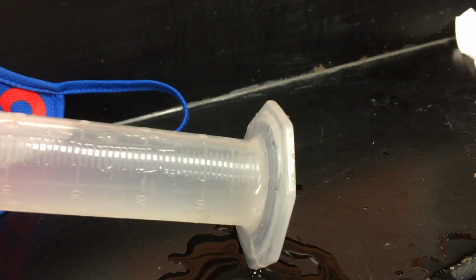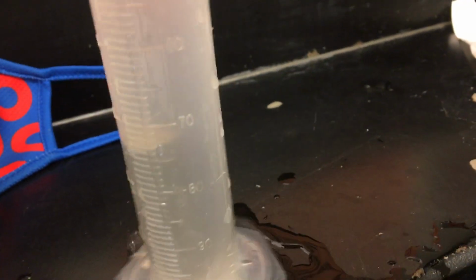Looking good. I'm liking it at right about 45. Drop it in. Not splash. And it looks like we went up to about 51. So if I went from 45 to 51, how much? Once again, that was number four.